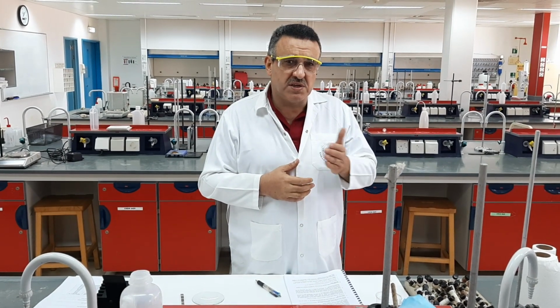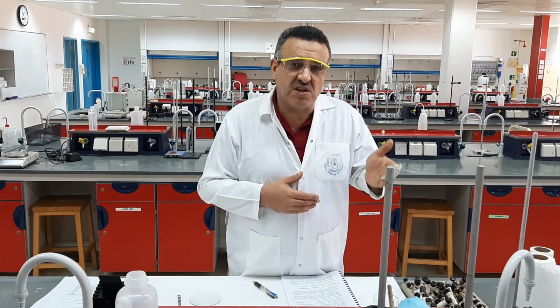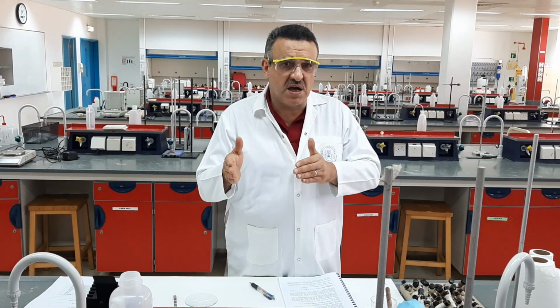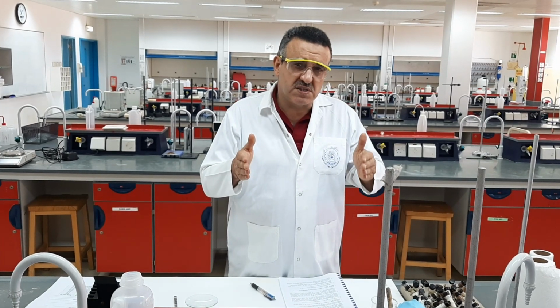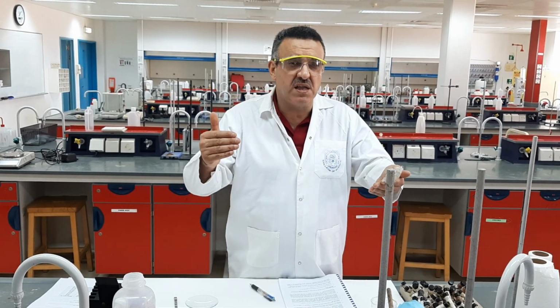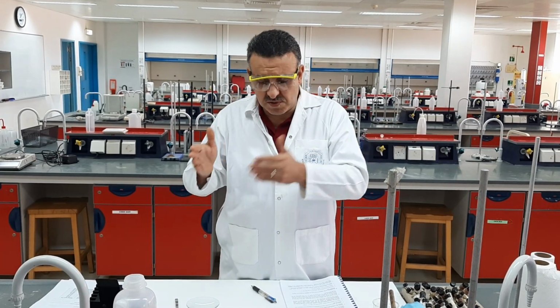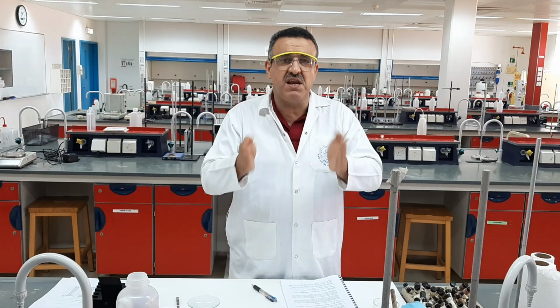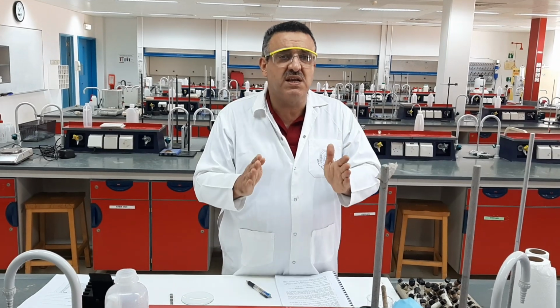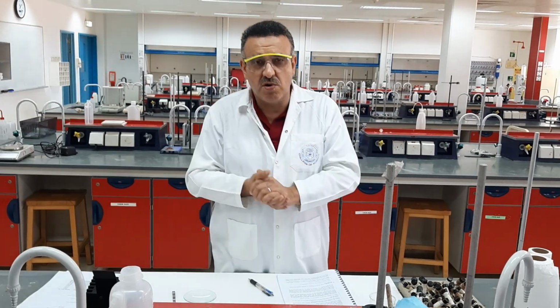In principle, as organic chemists, we are always interested in two things: the range of the melting point. In the range of the melting point, we have the lower end and the higher end. The lower end is always the temperature at which the compound starts to melt, and the higher end is the temperature at which the compound has fully converted from solid into liquid. So this range is extremely important for us as organic chemists, because, as I said before, it will give us an idea about the purity of the compound, whether the compound is pure or not pure.